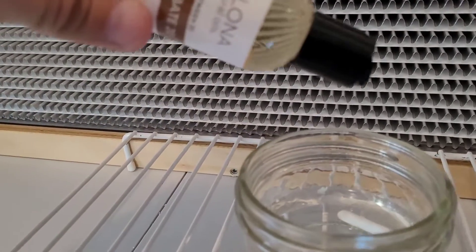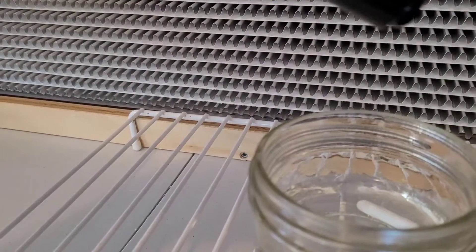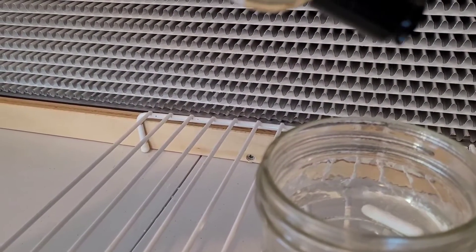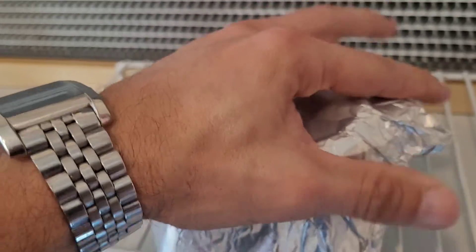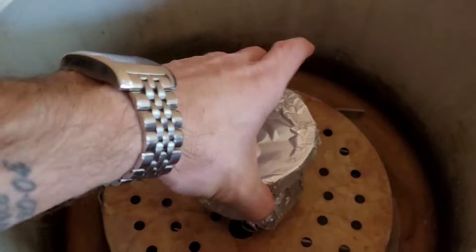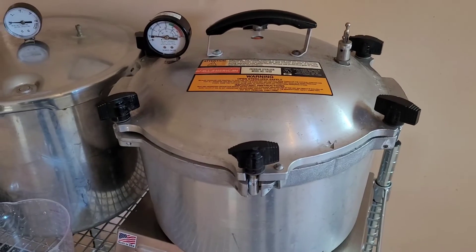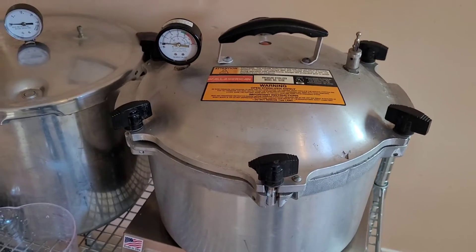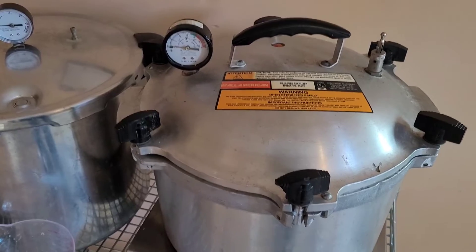Top of this. There you go. And the lid. Ball cap. PC. Then I'll be running this in my All-American for 20 minutes at 15 psi.